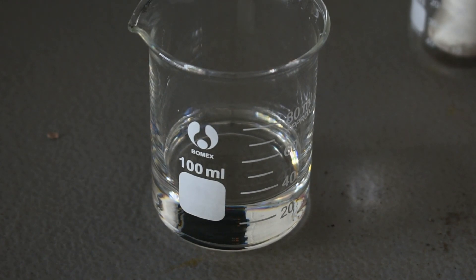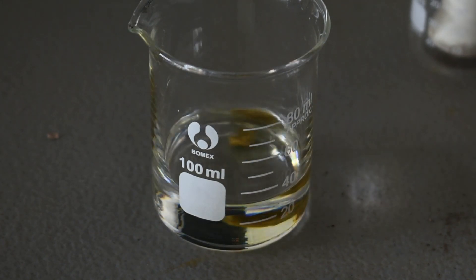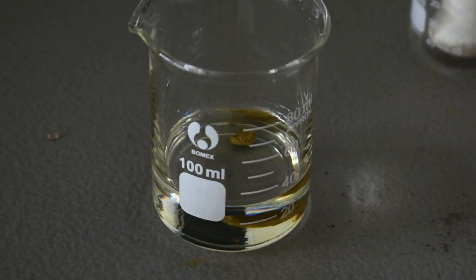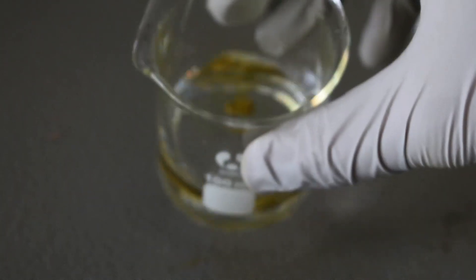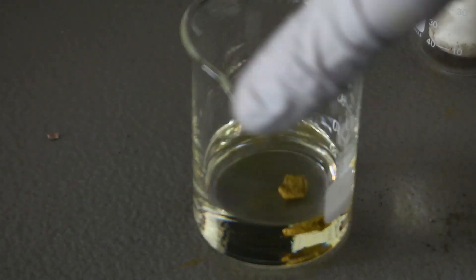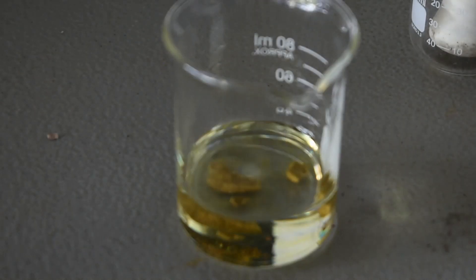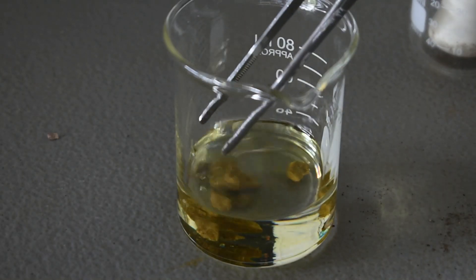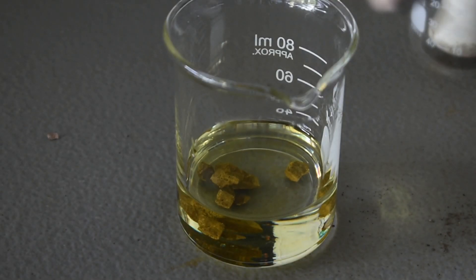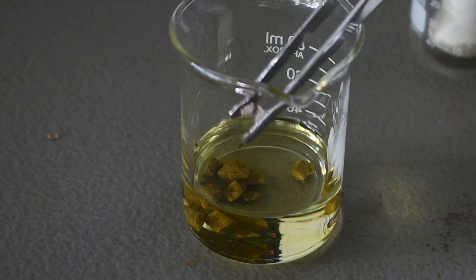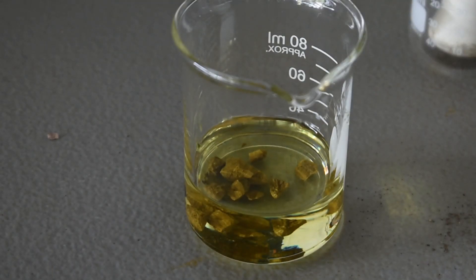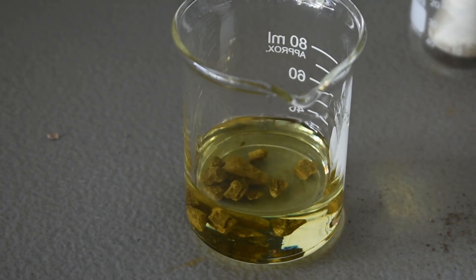So you see a yellow color appear almost immediately. See that yellow? So we'll continue adding the iron 2 chloride. The yellow color is becoming very evident now.